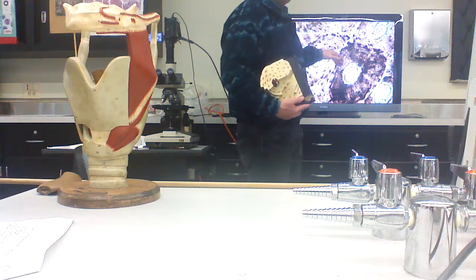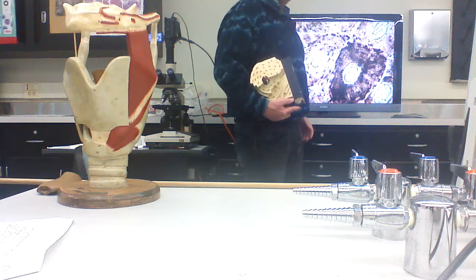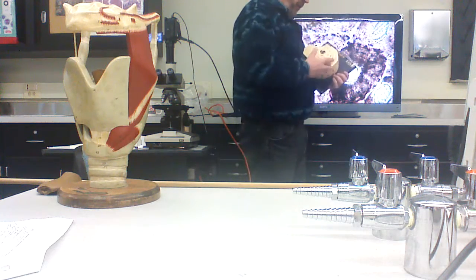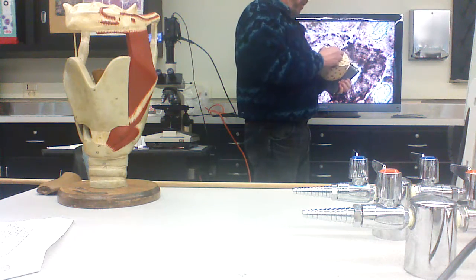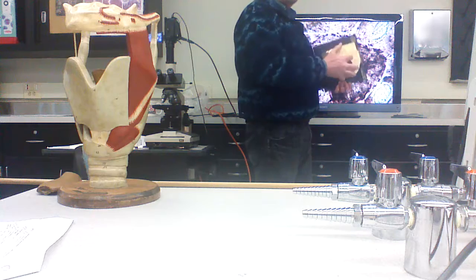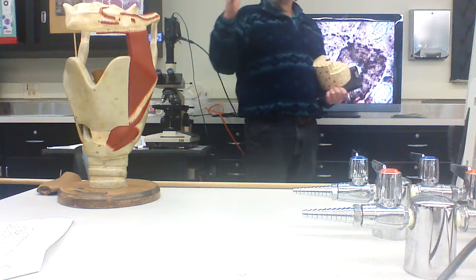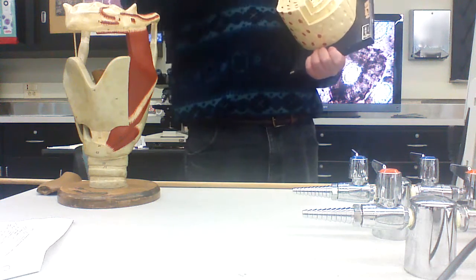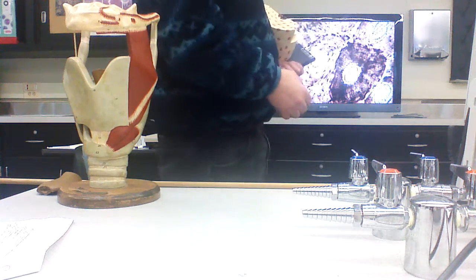In fact, the whole bone is vascularized. In here, it's at least a capillary, maybe, depending on the size of the unit, a small arteriole or venule. Here you see a venule, an arteriole. The white things are nerves. The green things, as they usually are, are lymphatics. So the entire bone, the entire osteon, is vascularized. And in fact, they're just stacked one on top of each other to make the bone.